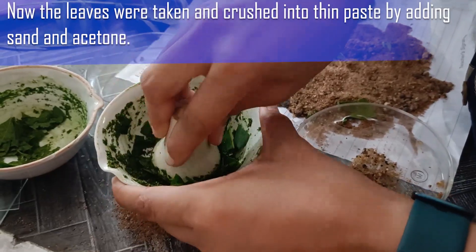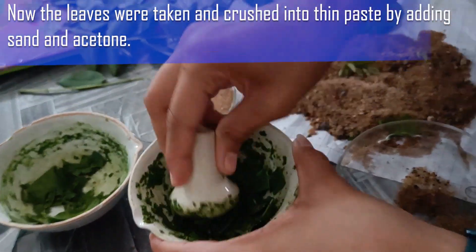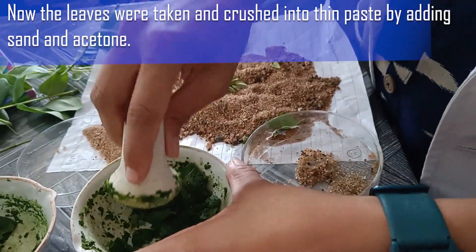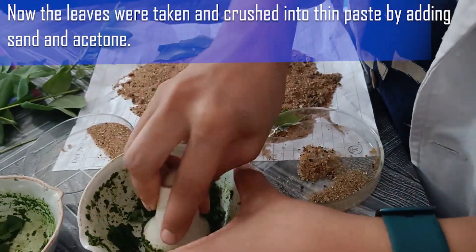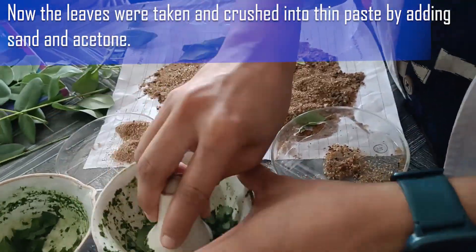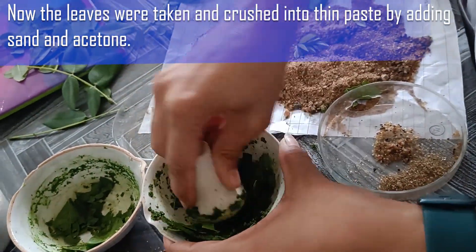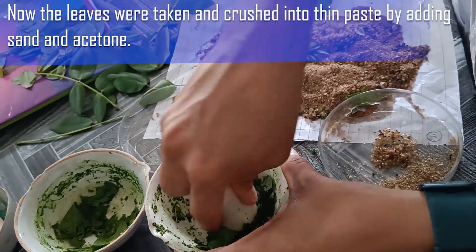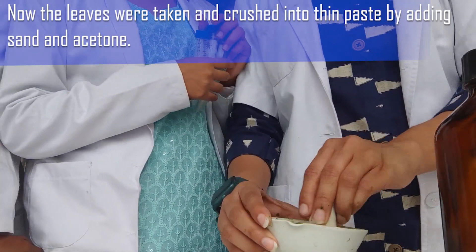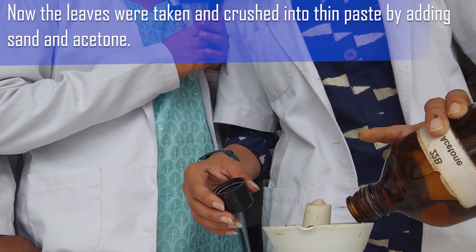Now the next step is to prepare the paste. Take leaves — always try to take leaves that are soft in texture, as they will be easier to crush. Crush them into a thin paste, then add sand and acetone to it. Do not add too much sand — just a small amount. You can add more acetone if the paste is too thick.